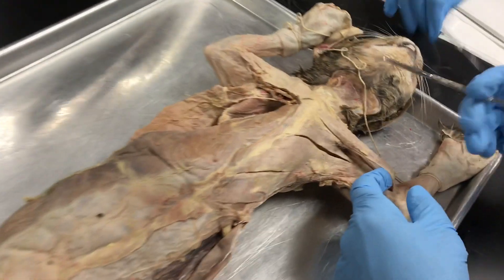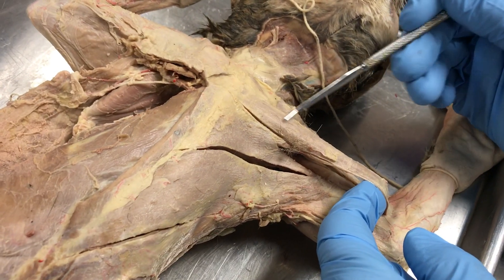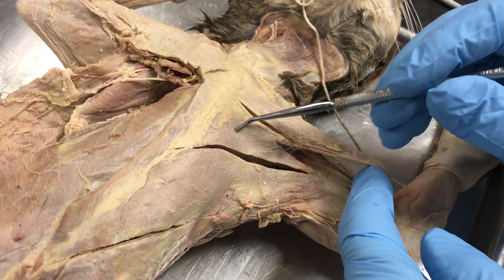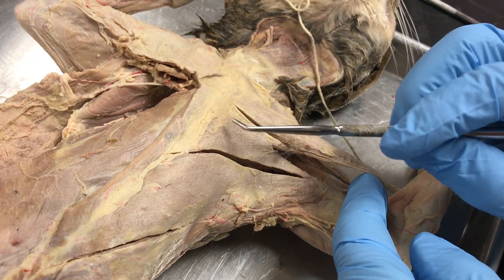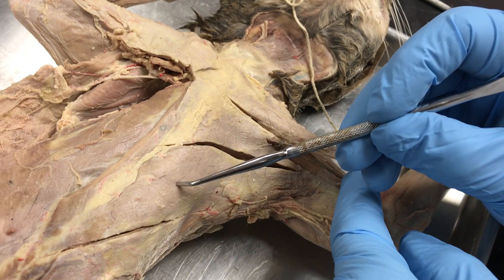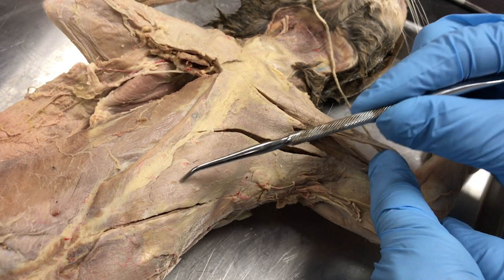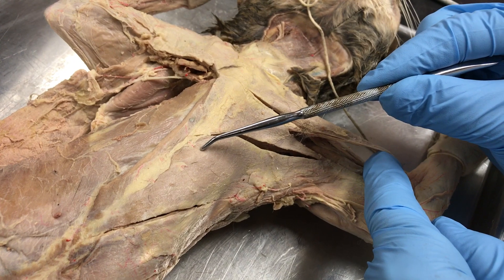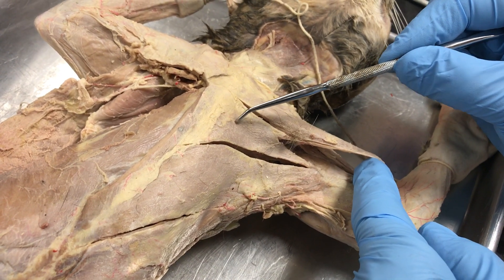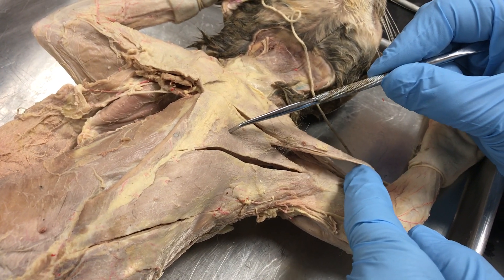Here we're going to name the muscles of the cat. This is the pecto-antibrachialis, a muscle that humans do not have. This is the pectoralis major, which extends all the way under the pecto-antibrachialis. This is the pectoralis minor, and this is the xiphihumeralis. Notice that the pectoralis minor very often is larger than the pectoralis major in the cat, because remember these muscles are named from the human.